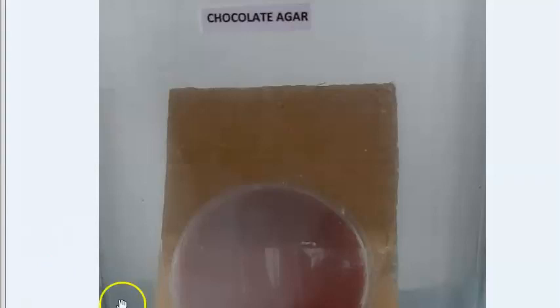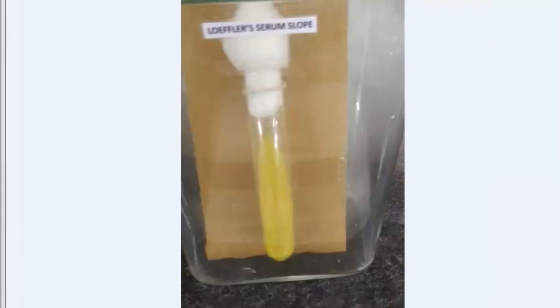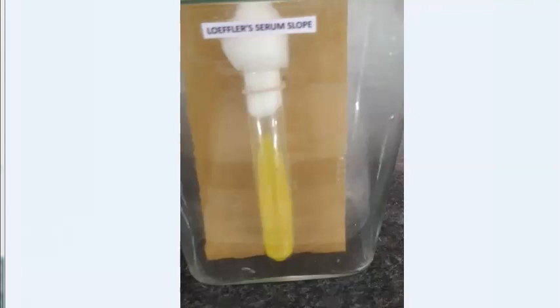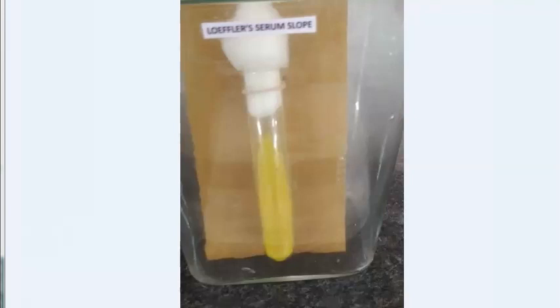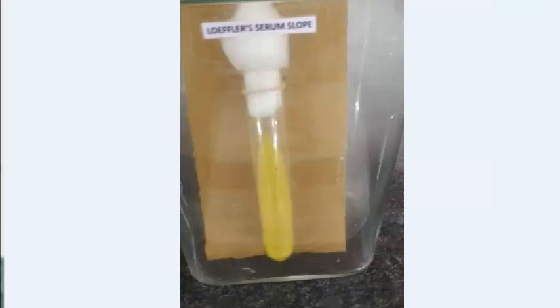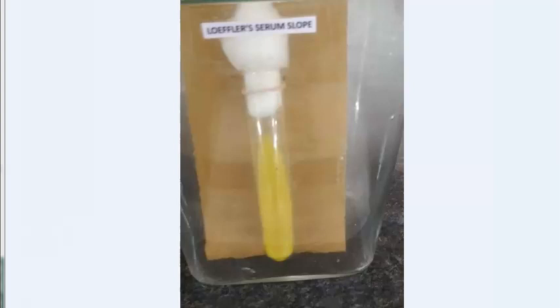Loeffler's serum slope is used for isolation of Corynebacterium diphtheriae. It contains nutrient broth with serum and glucose, and is sterilized by inspissation.